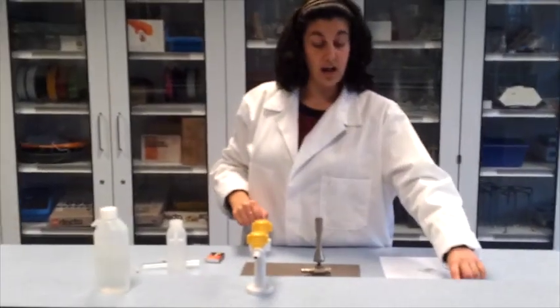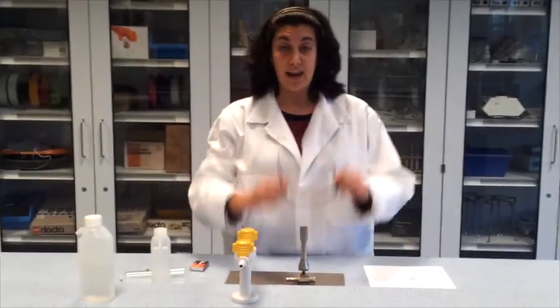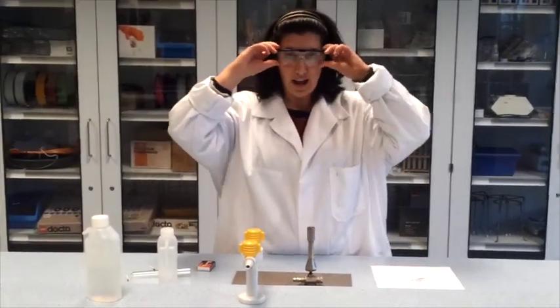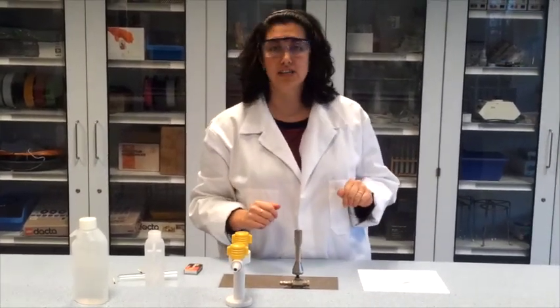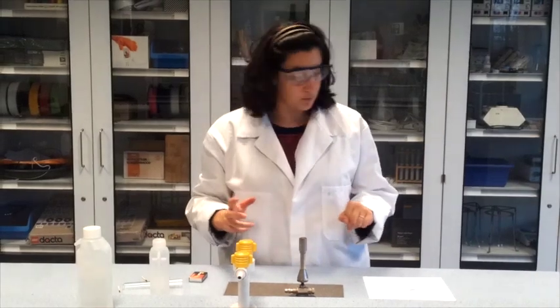Next we check if I'm wearing the safety goggles, and I'm not, so here we go. I know it looks a bit stupid and not very fashionable, but it's for our own safety when we are working with chemicals.